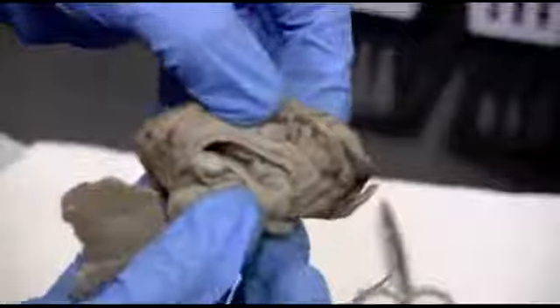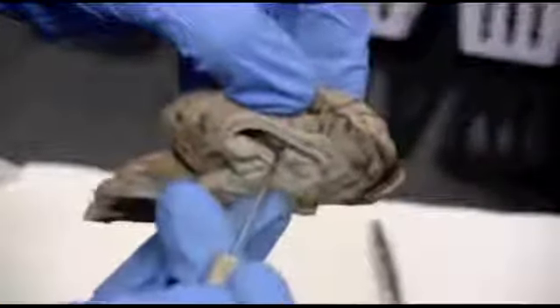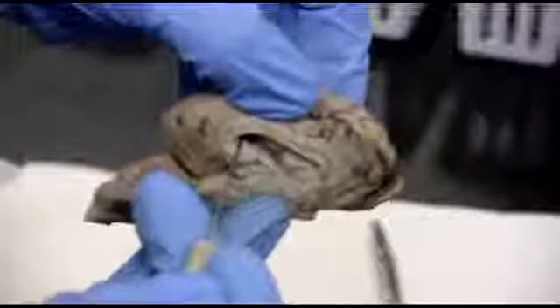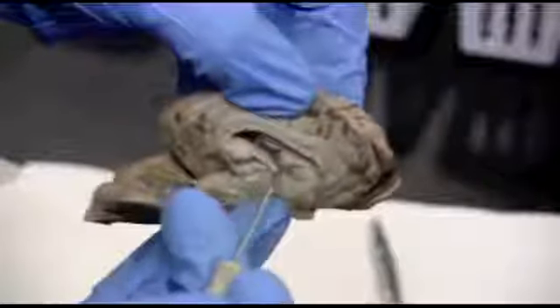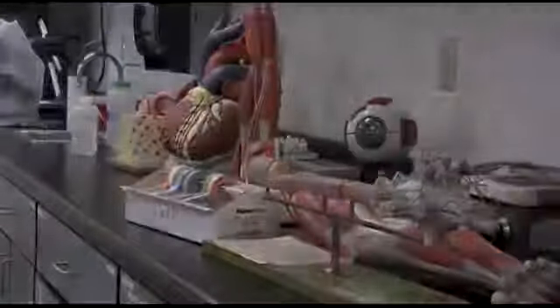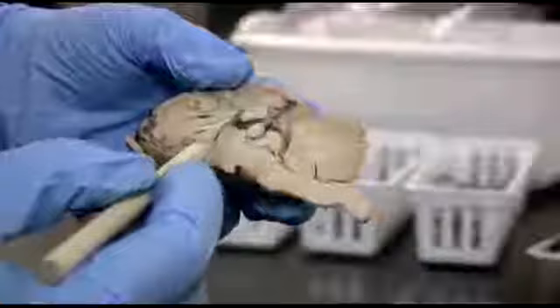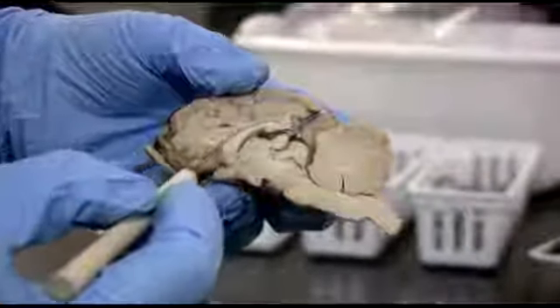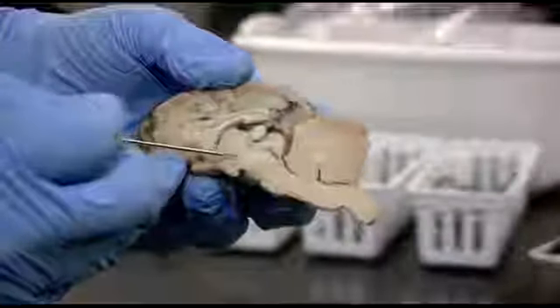That pigmented area, this dark tissue right here, that is part of the choroid plexus. Those are the specialized ependymal cells that produce the cerebral spinal fluid. So you're going to find those in certain areas of the ventricles, and this is a really good example. Here's that other half where we had the corpus callosum and the septum pellucidum in front of the lateral ventricle. Down below, we have this really well-formed circle.